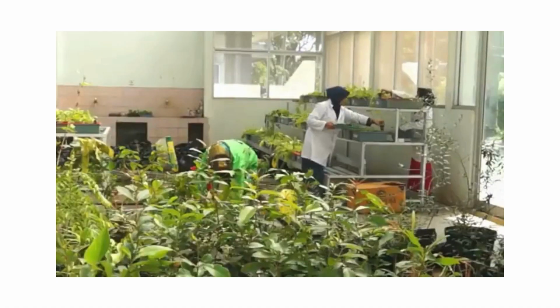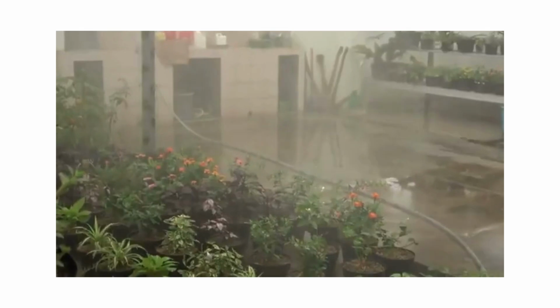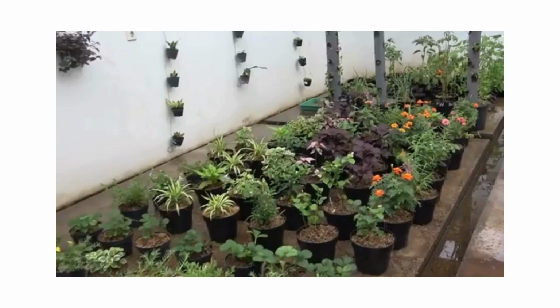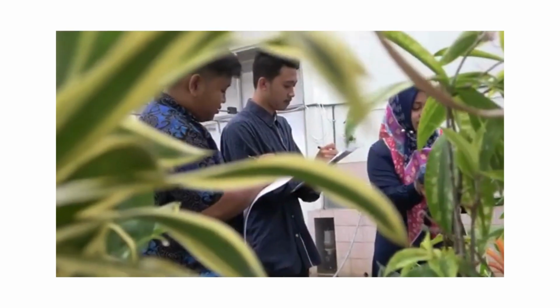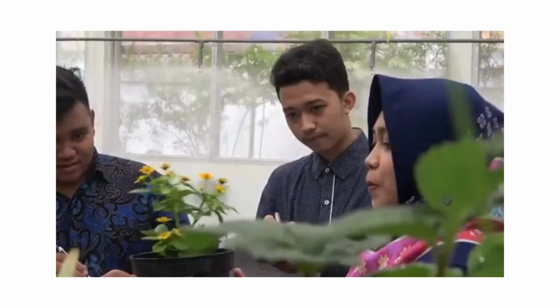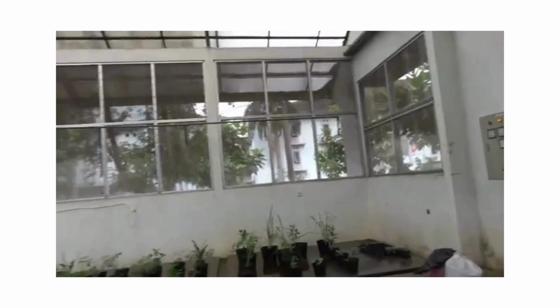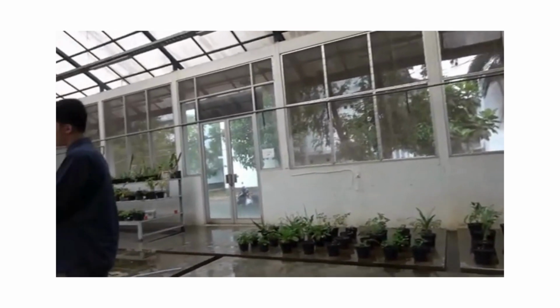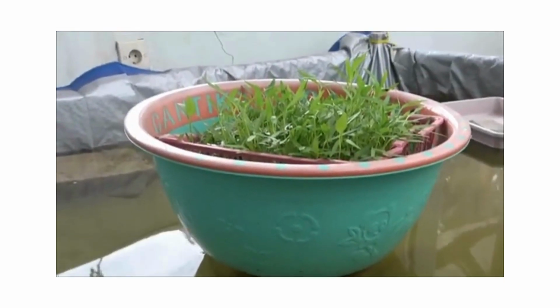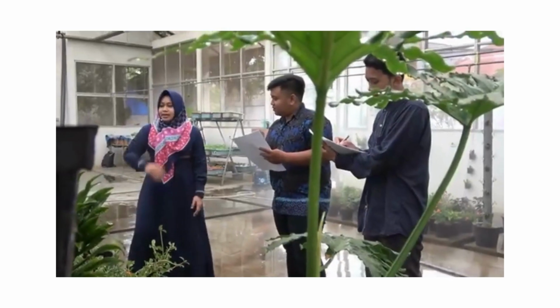Greenhouse. The greenhouse is one of the outdoor supporting facilities for practicum and research based on plant cultivation. This supportive facility is located outside of the biology study program building but is still within the scope of the area. It can accommodate 40 to 50 students. The greenhouse facility can be accessed on a daily schedule during working hours from 8 a.m. to 4 p.m. One of the activities often carried out in the greenhouse is the cultivation of several local plants from East Java. Other activities carried out include a botanical garden student group that carries out organic vegetable cultivation through hydroponic and aquaponic techniques.